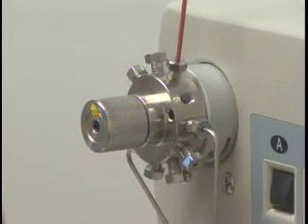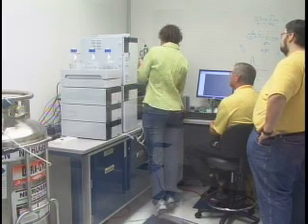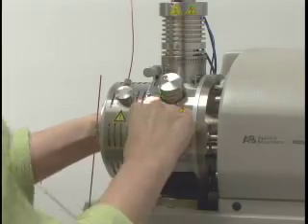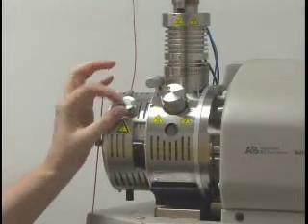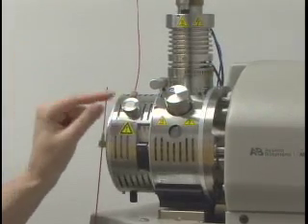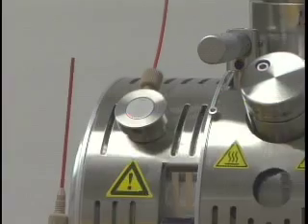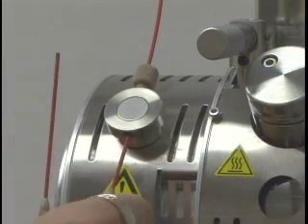This part of the source housing — you can actually take out the center piece of metal and put in a second union that has a three-way joint in it, so you can be running mobile phase at the same time that you're infusing a compound. That is another added feature to this system.